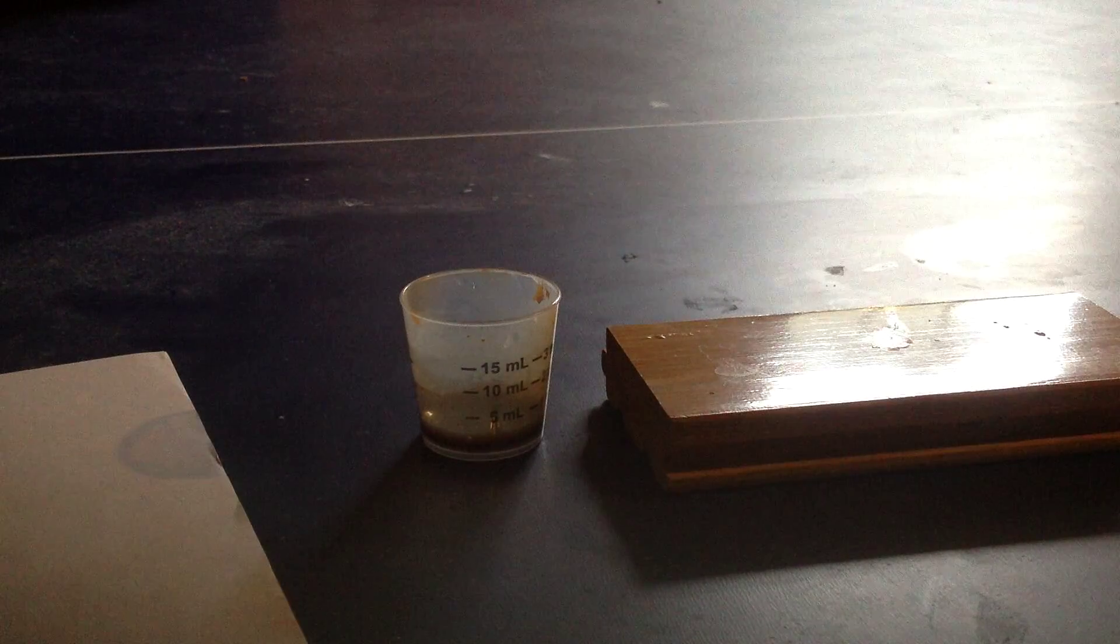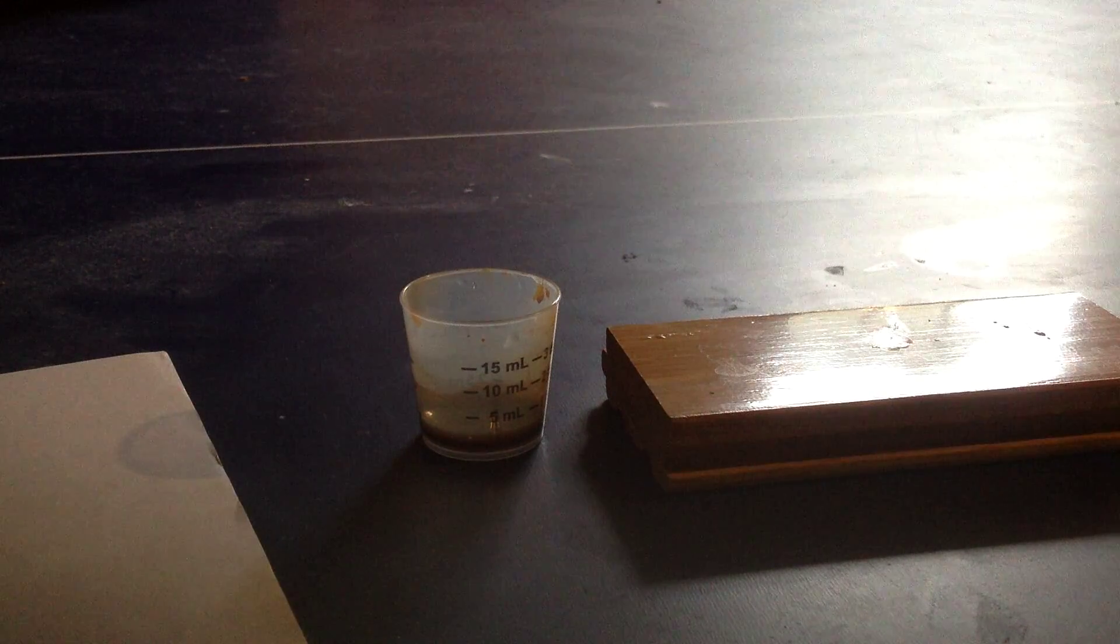So this video will be showing you how to make magnetite and I got the inspiration for this from two things. One, I need magnetite for some battery electrodes that I wanted to make.